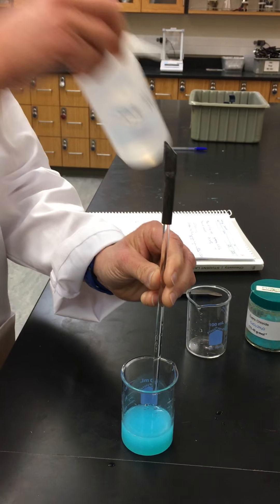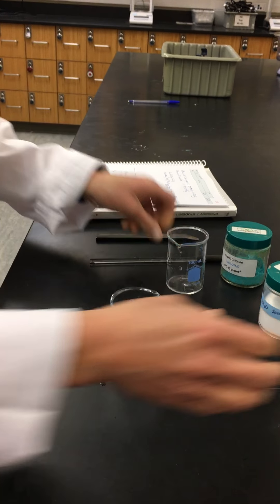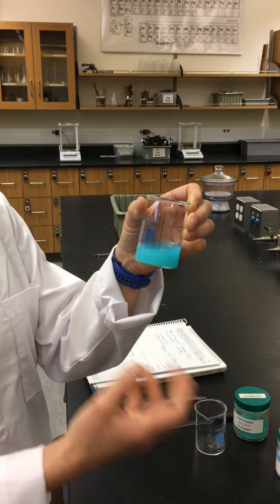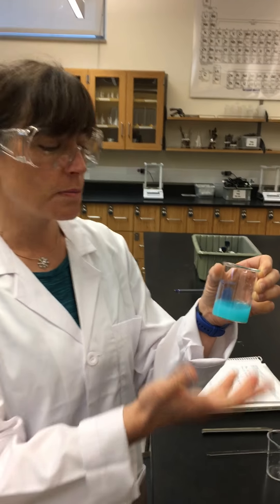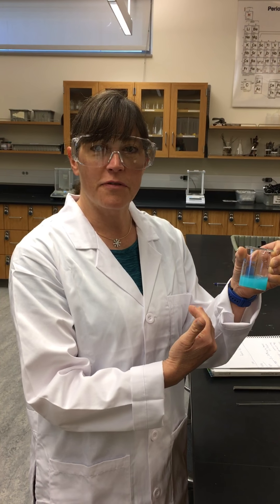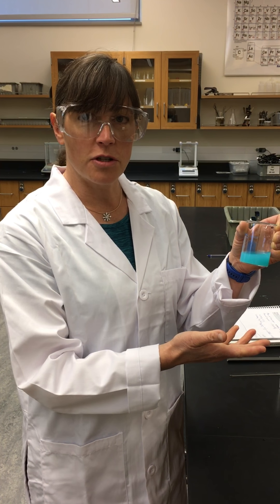To be able to measure how much copper phosphate — that is the precipitate we produce — is produced, we're going to need to weigh the copper phosphate. But there's water, spectator ions, and lots of other things that would throw off the weight. So we need to remove the solution and spectator ions from the copper phosphate. To do that, we're going to use a process called filtration — specifically vacuum filtration.